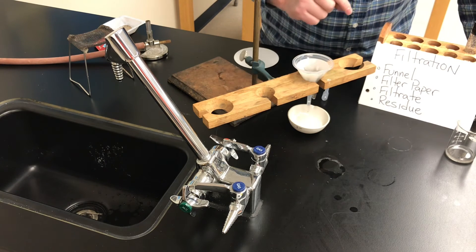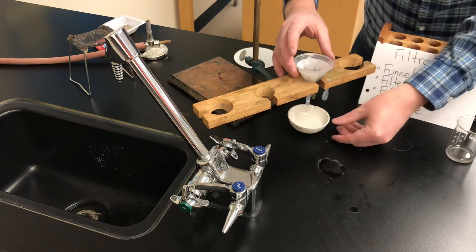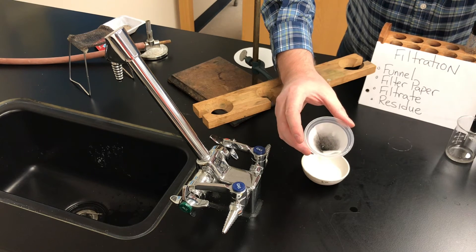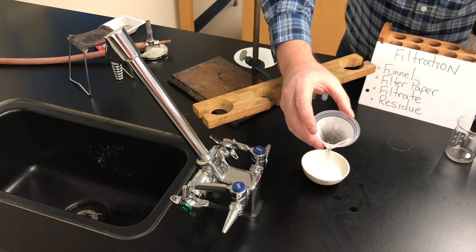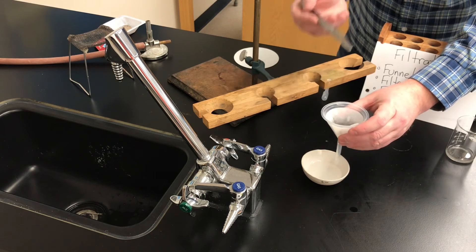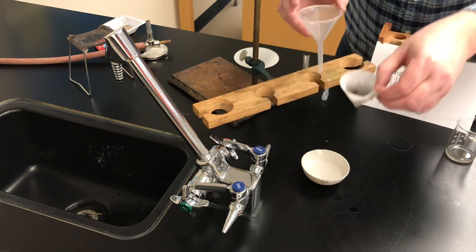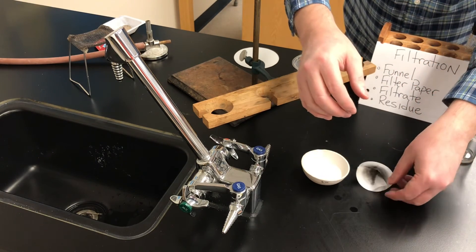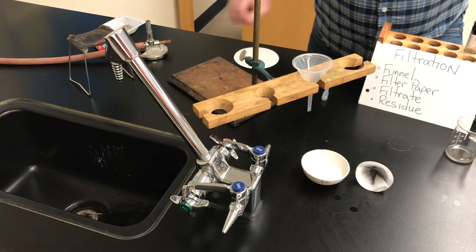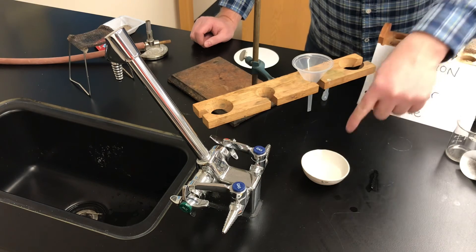The filtering is almost done — there's very little liquid left in the funnel and the dripping has slowed down quite a bit. I'll pull the funnel out of the clamp and bring it over so you can see. In the filter paper you can see the black residue — that's the black charcoal. We now have a sample of pure charcoal. We could scrape that off onto a scoop, or open the filter paper, lay it down on a desk, and take a picture as evidence. We'd have a sample of pure charcoal.